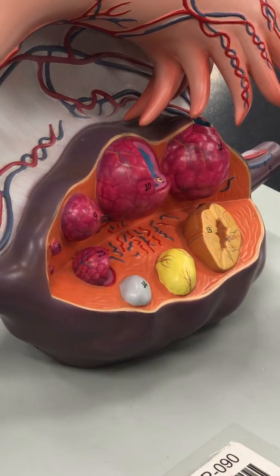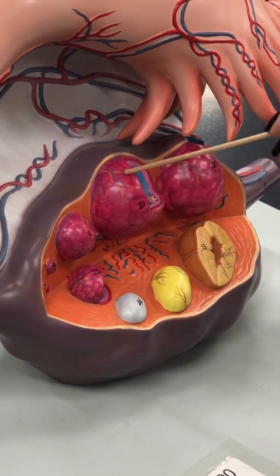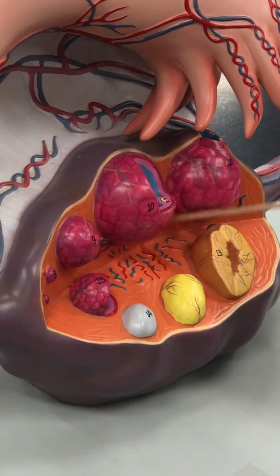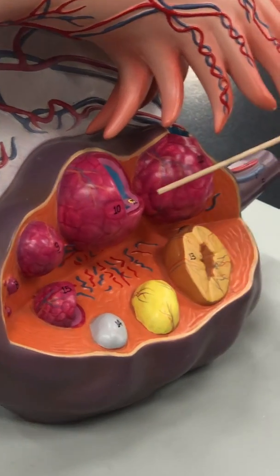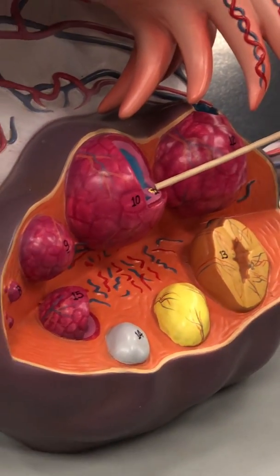There are two other names for tertiary follicles. Sometimes you might see it called mature follicle or Graafian follicle. Right? All of those are fine. Within your mature follicle, you have the oocyte. See that little yellow dot right there? Right? That is the actual oocyte.